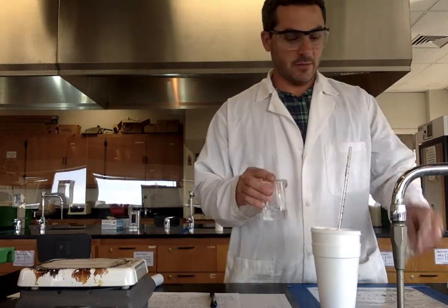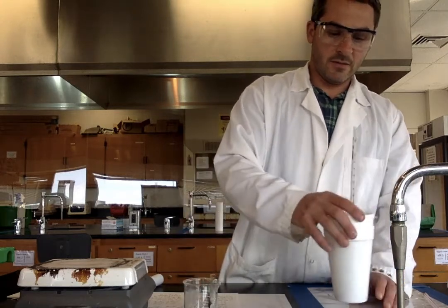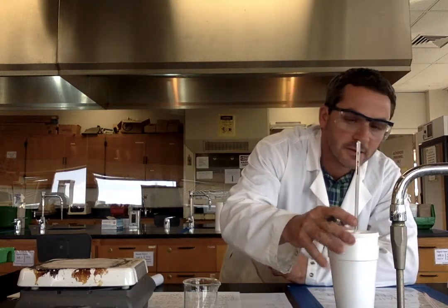Now, take this thermometer out, pour this in here, mix it, and record the temperature once I get there. Right, I got 58.8. And then another 30 seconds, take another reading. Give it a nice mix up there. And now it started going down, 58.6. Actually 58.0.